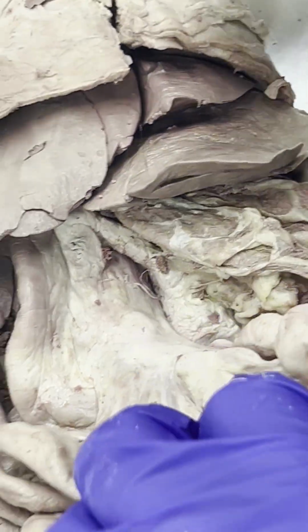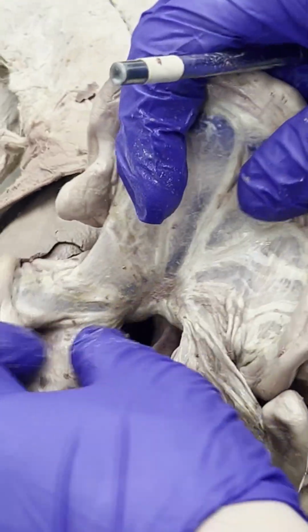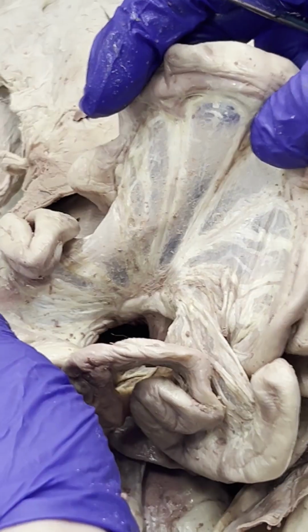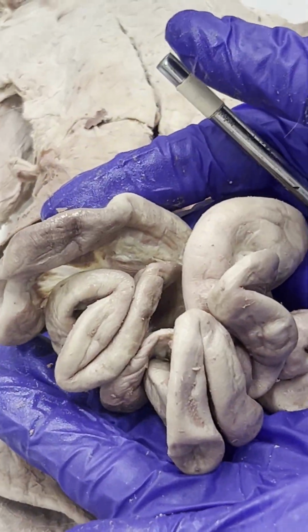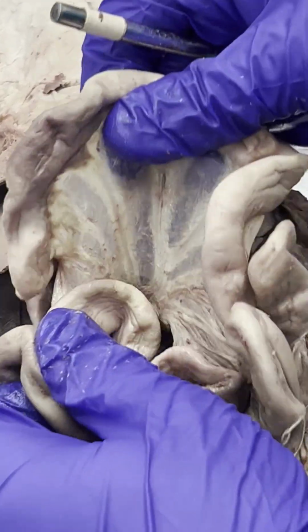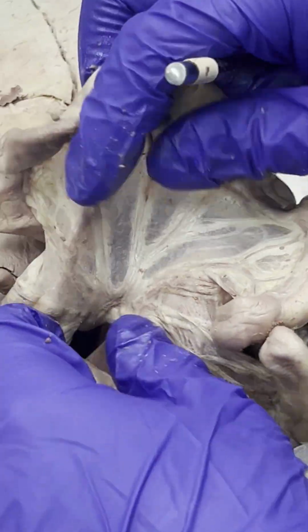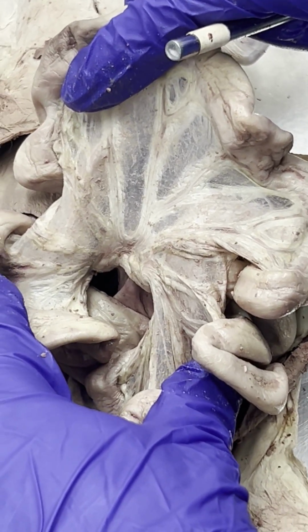Because we're in here as well, one of Dr. Mick's favorite things to do is to open all this up. And this is the mesentery. The mesentery supplies blood to all of this, which is the small intestine: duodenum, jejunum, ileum. The mesentery is all this tissue in here that's supplying the blood, again, to the small intestine. And there's lots of lymph nodes in here as well.